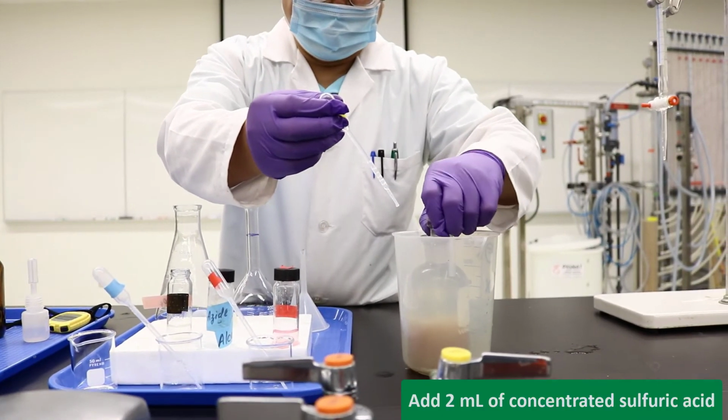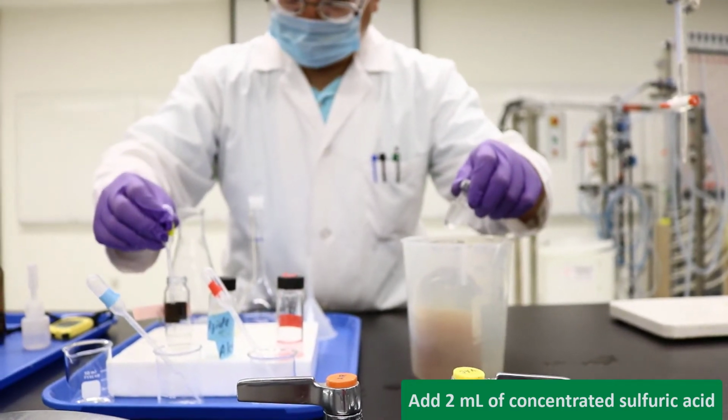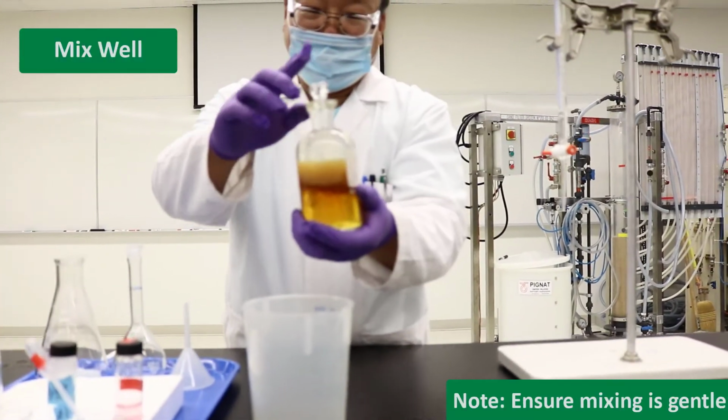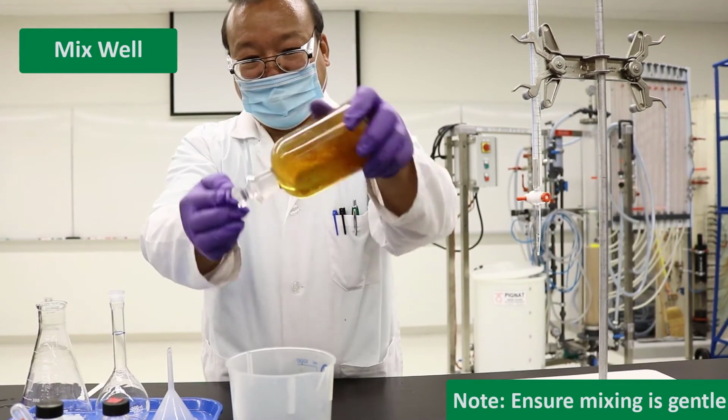Remove the glass stopper and add 2 milliliters of concentrated sulfuric acid to the sample. Insert the glass stopper and drain off any excess liquid. Mix by inverting several times to dissolve the precipitate.